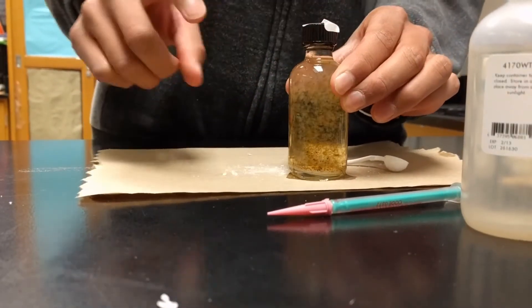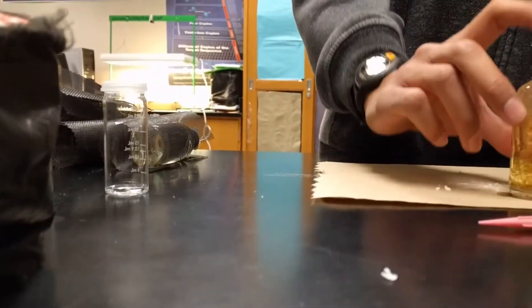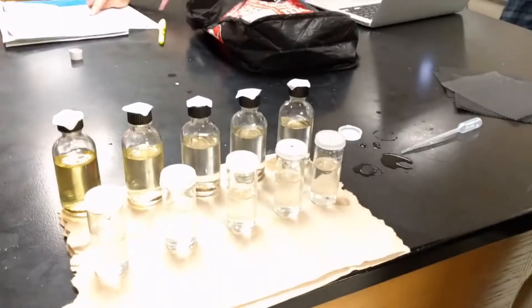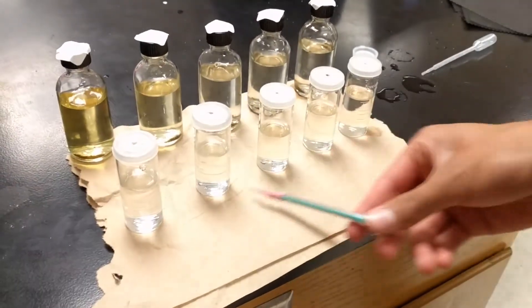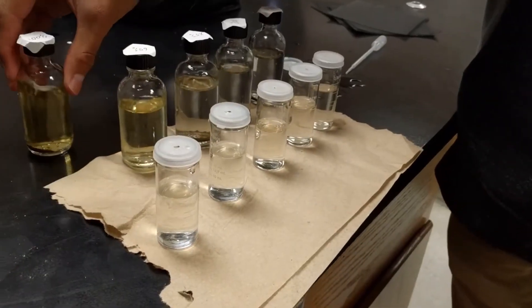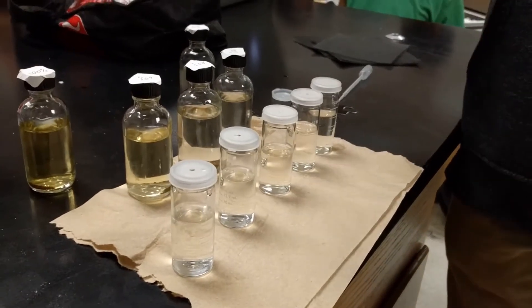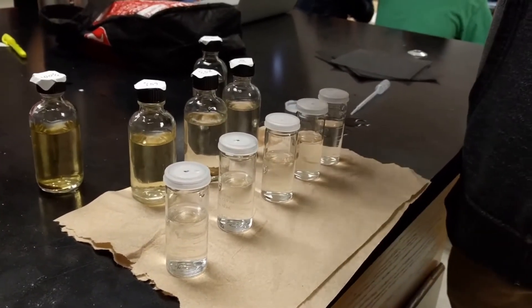It is important to finish doing this to all of the bottles — these three steps — to fix the oxygen and ensure consistency throughout all of the samples. We titrated all our samples. They are all clear and we recorded our results in our lab books. The full light and 0% light are the most important for calculating and analyzing primary productivity of the pond ecosystem.